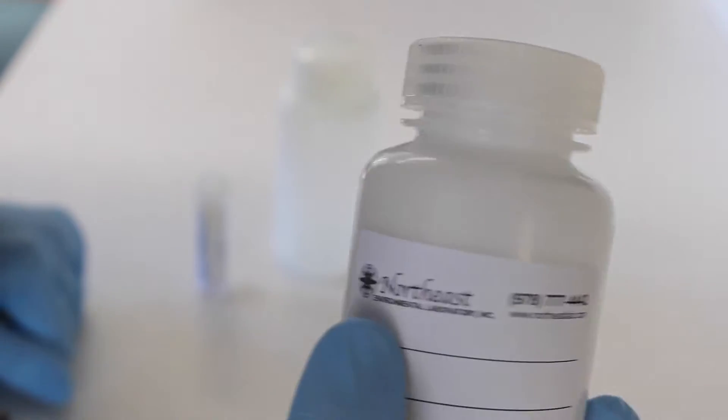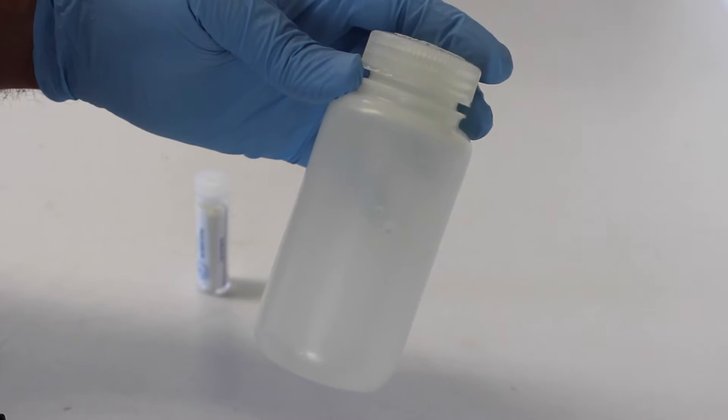You will also need the provided sample bottle pre-preserved with sodium hydroxide. Finally, you will need a clean bottle to dechlorinate the sample prior to preservation.